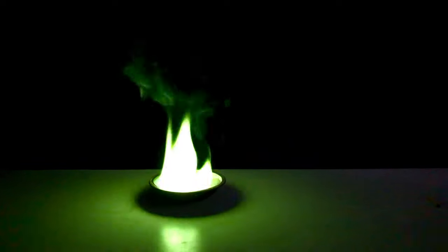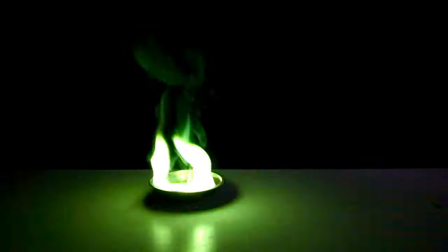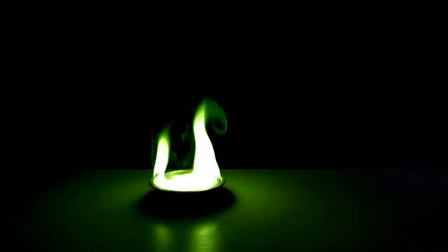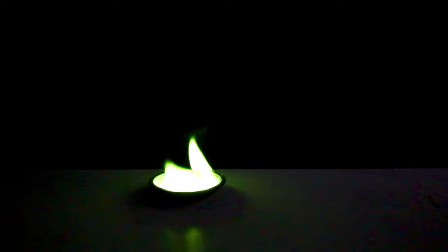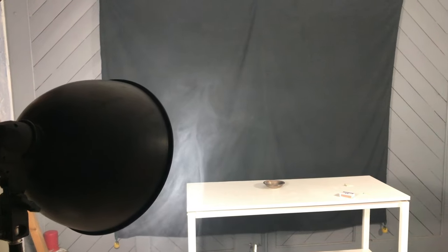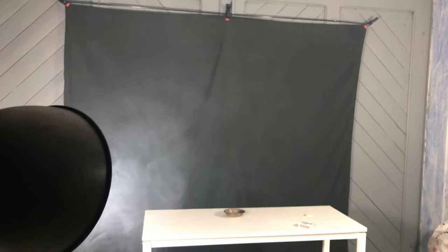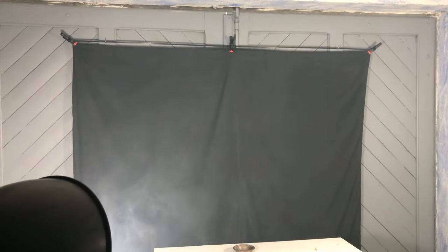For this reason a gas mask was used. You can either now skip parts of this video or you can just enjoy the rest of the flame until it dies down. You can see that really a lot of smoke was produced. The entire garage was filled with smoke.